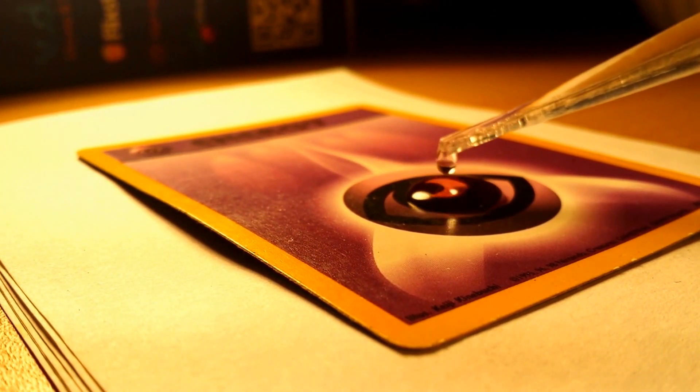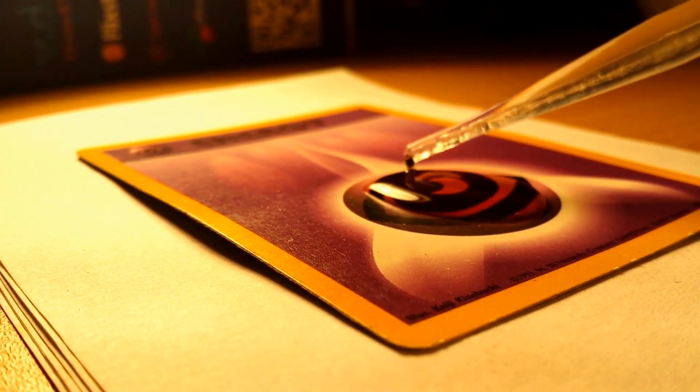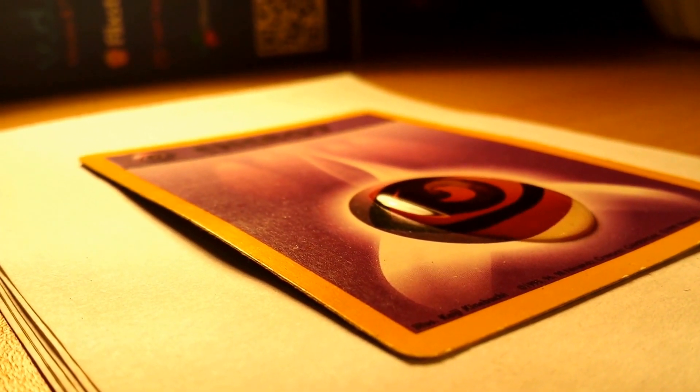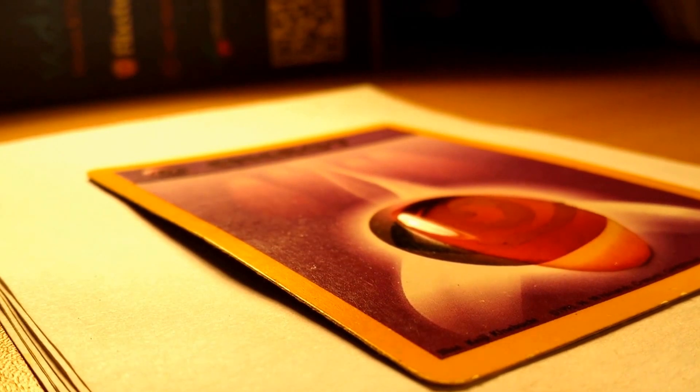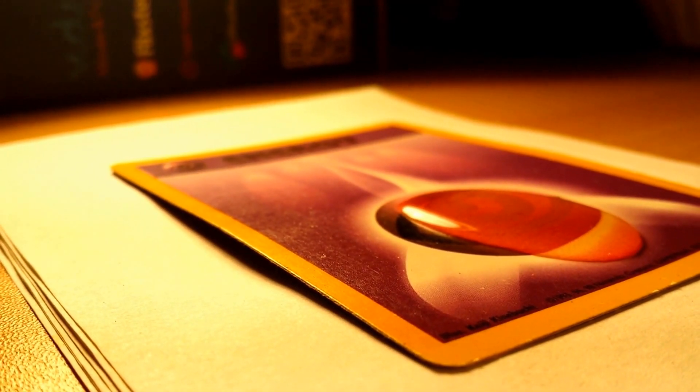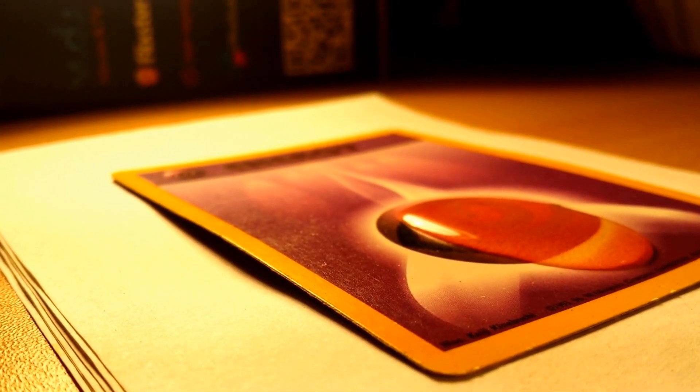Oh yeah, that's pretty good. Oh, it's sliding down. Oh, it's like a magnifying glass. Oh, it's turning red. Wow, that's really cool.